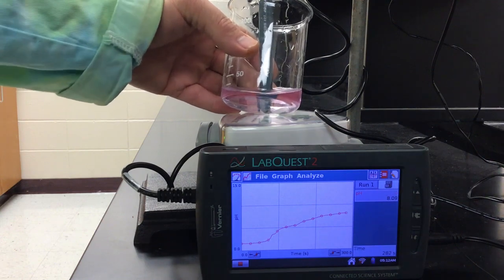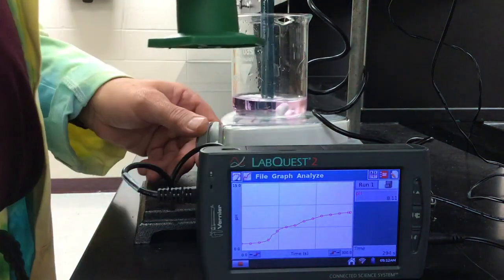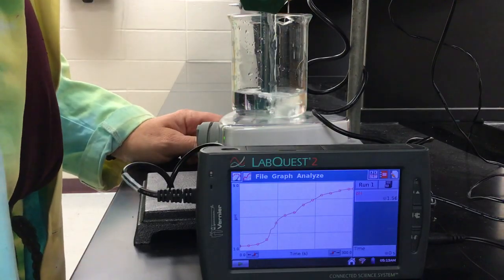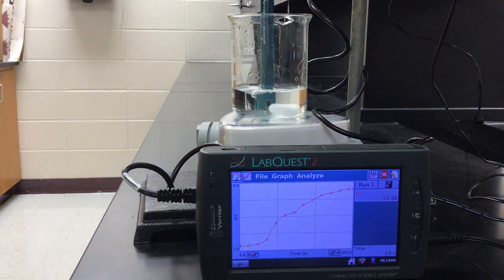So at this point, it should be at the equivalence point, the point at which the moles of acid and moles of base are the same. What I'm going to do is add in the other 25 milliliters to this. Let's get my pH probe set up. I'm going to turn my stir bar back on, and I'm going to go ahead and add the other 25 milliliters of acid. So what I've done is I did find the equivalence point with 25 milliliters of acid, and now I've added 25 milliliters of acid back in there.